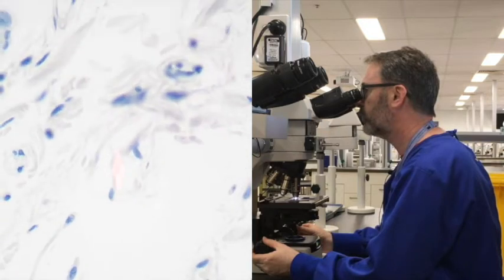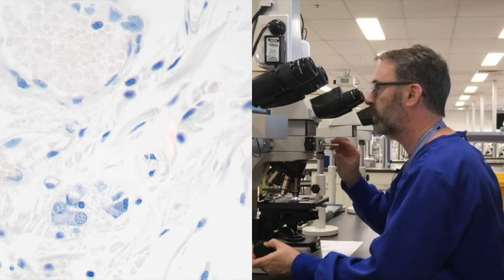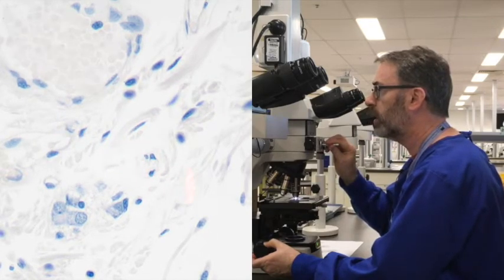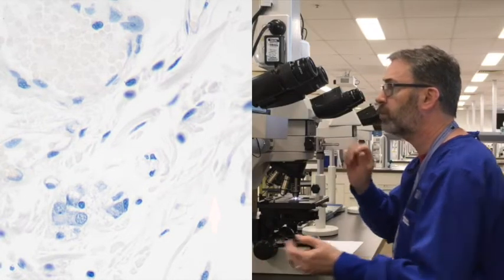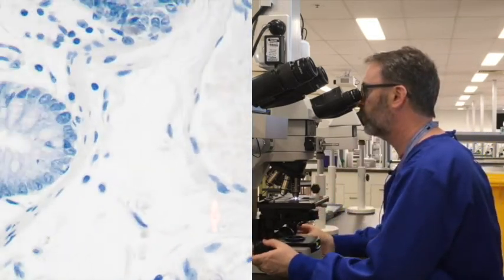If we go out now into the connective tissue, where there's collagen and some blood vessels, we see here that the collagen now has a little bit of contrast. We can see it, but I certainly wouldn't call it blue. It's kind of almost a sort of muted off-white colour. So it's dramatically less than what we had before.